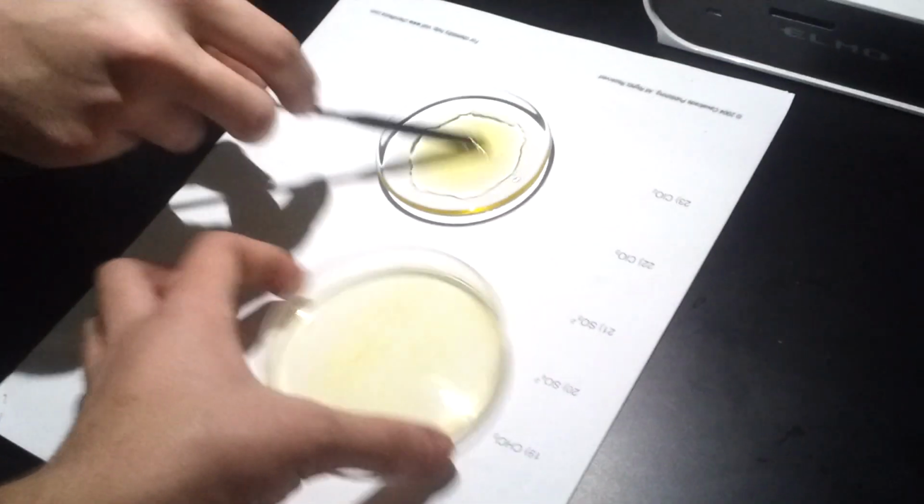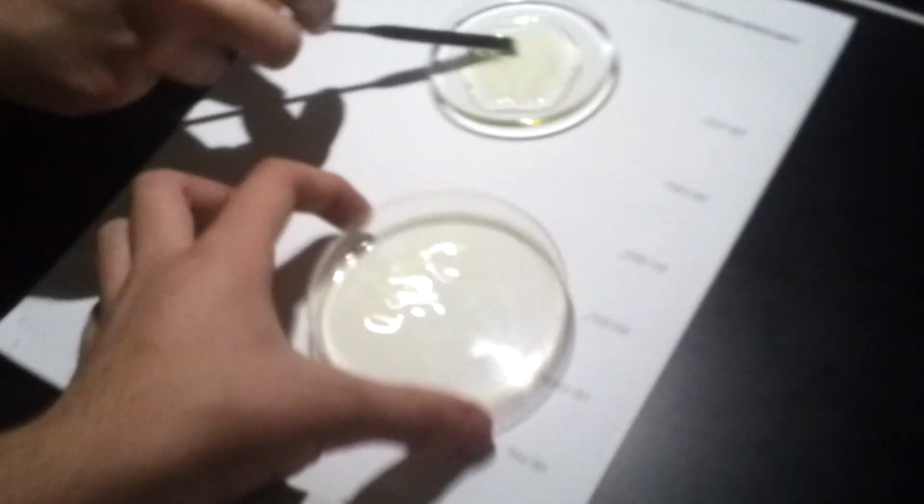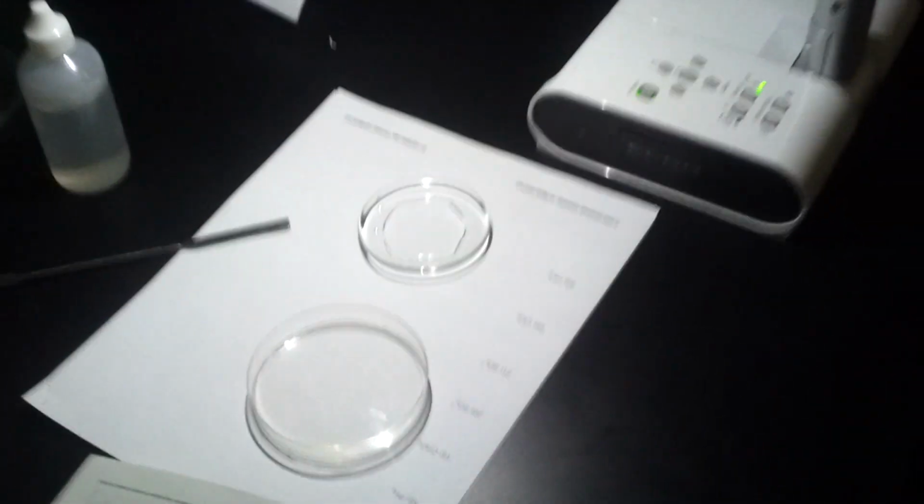I'll mix this one. I need someone to just shake this back and forth until it goes clear on the right. Someone with a steady hand. Just back and forth until it's almost done. Just has to get clear. You can smell that? That's bromine. It smells a lot like bleach. You see it's going clear? And then we add the indicator. It's done. That's pretty cool.